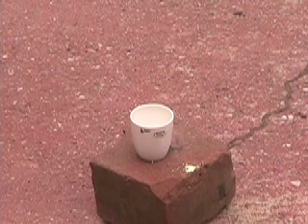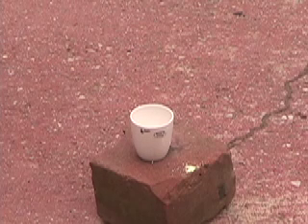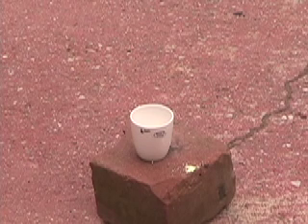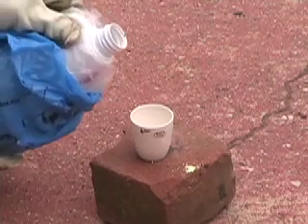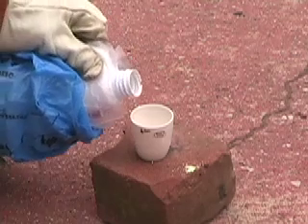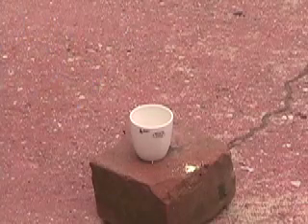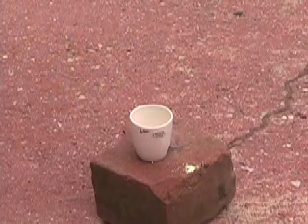So there's sugar in this crucible, and let's see if the sulfuric acid — which is a dehydrating acid — can suck the water right out of the sugar and make carbon. You'll see the sulfuric acid when I pour it; it's just a clear substance. The reaction usually starts pretty slowly.